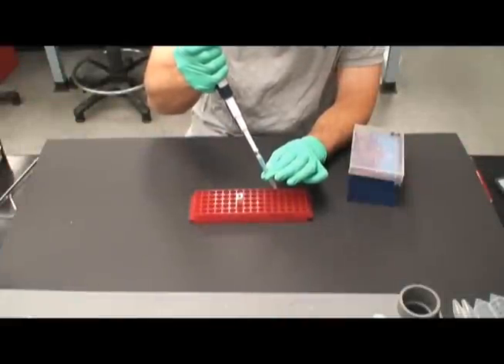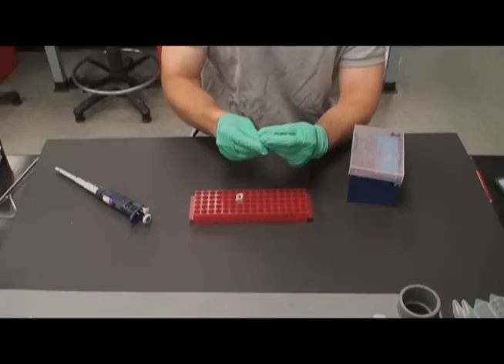Following incubation, re-suspend the cells. Make sure to use a different pipette tip for each tube.